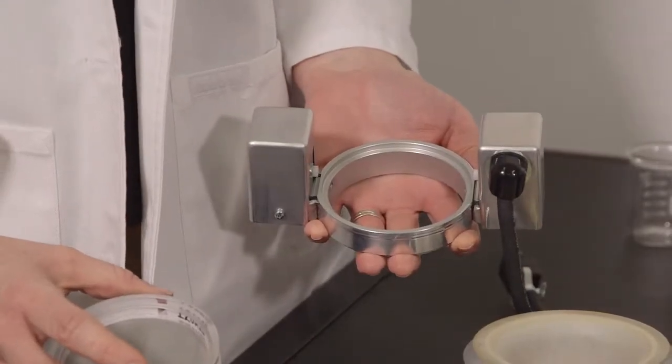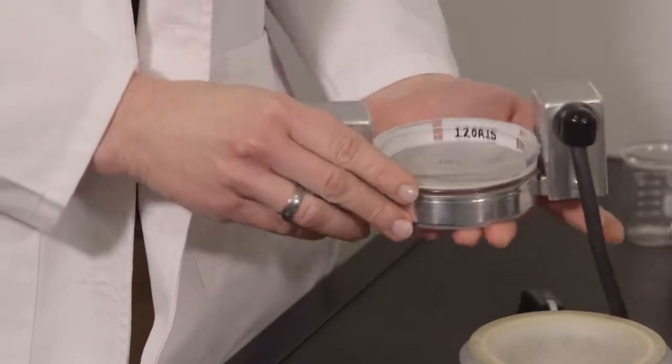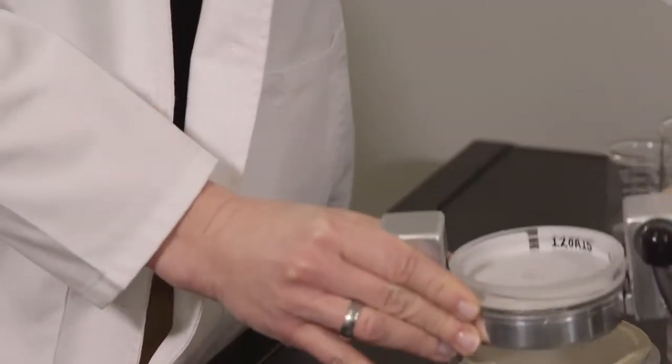Slide the finest sieve of your test stack into the ring assembly using a front-to-back motion so the tapper pins are properly depressed before operation.